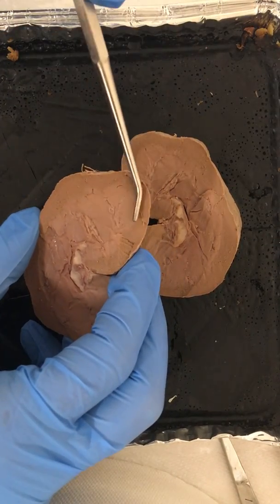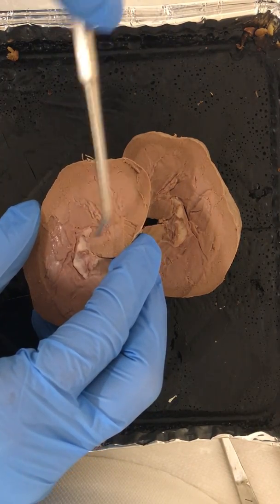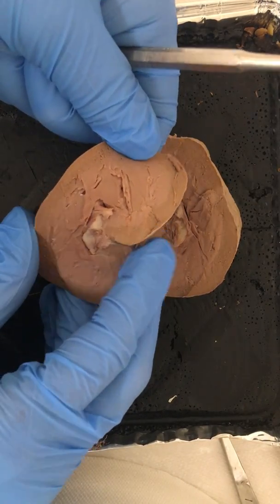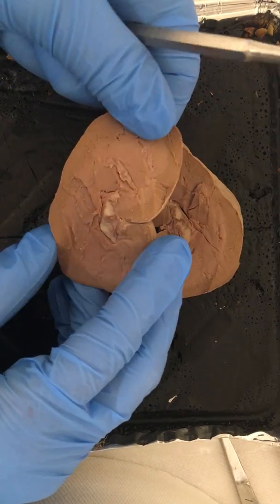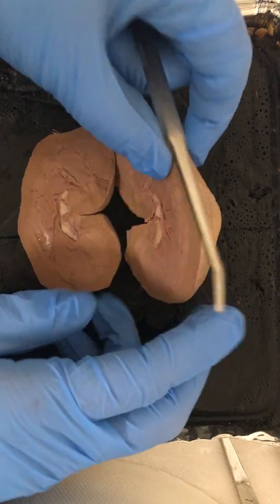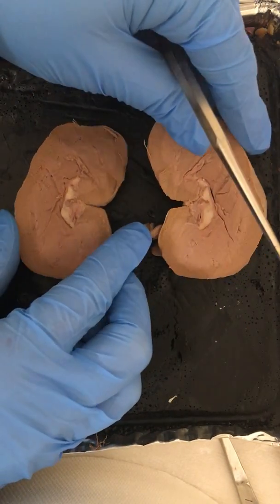Within the medulla, you'll notice these different pyramid sections. Those are also referred to as pyramids, and the apex of each of these pyramids is known as the papilla. Those papilla, which is difficult to see here, will ultimately lead into the minor calyx, which then leads into the major calyx, out through the renal pelvis, into the ureter, and then ultimately out into the urinary bladder. And so that is the flow of the urine production.